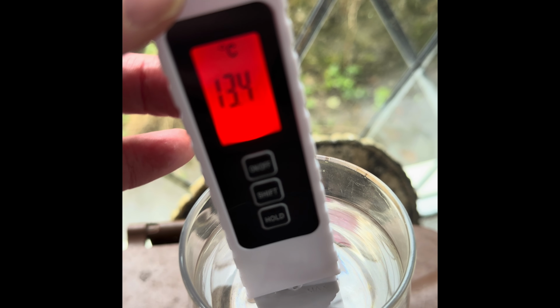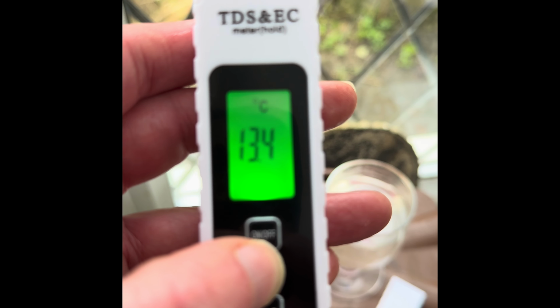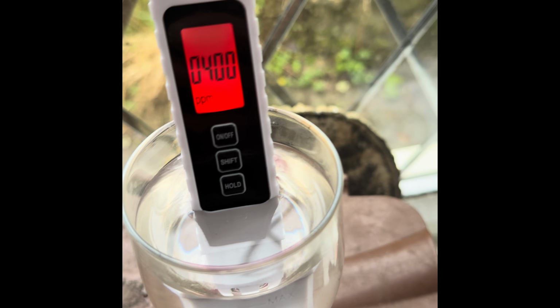So I'm just going to change the meter over now to parts per million. I just went 13.4, so a bit chilly all the same. So we're just going to shift this and get this in focus. So you can see that's temperature in Celsius. I'll switch that back on again. Then you can have a temperature in Fahrenheit, and then you can have parts per million. So this will show what particulate is in the water. So we'll see how that goes. So I'll just leave that in there for a second. You can see it's recording now.